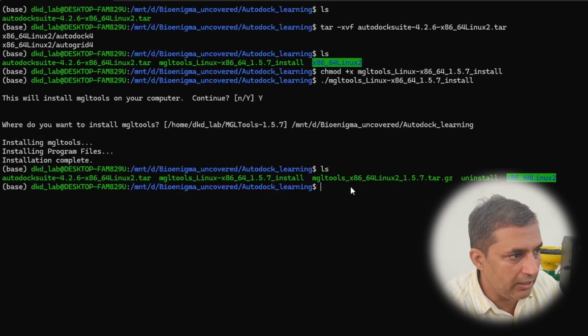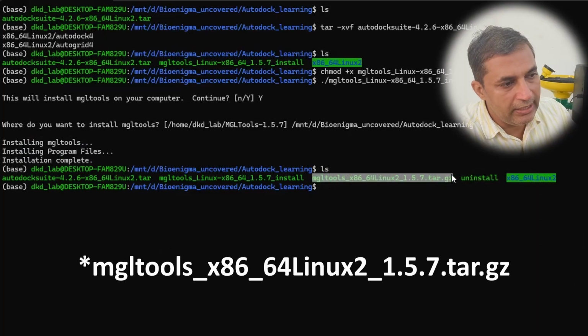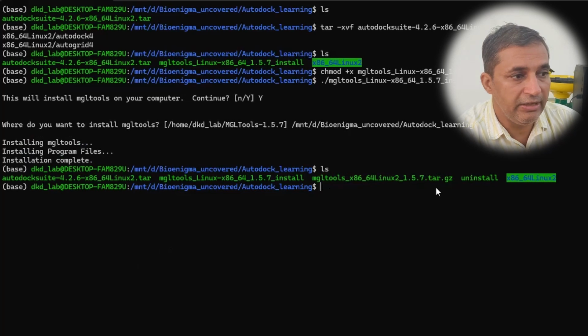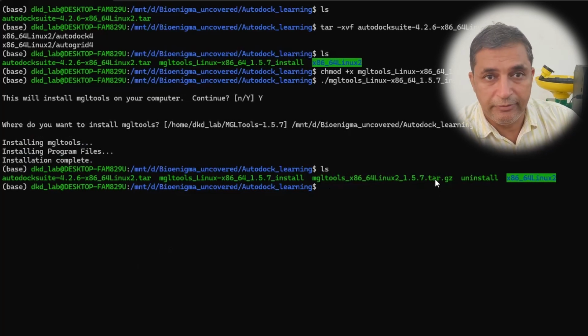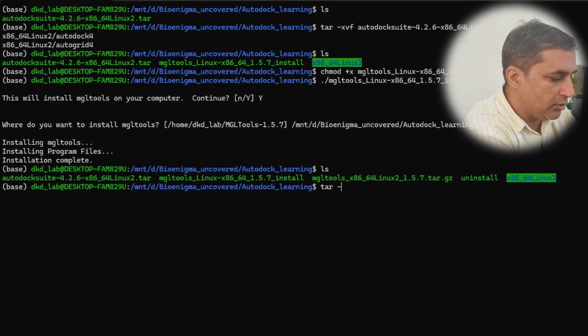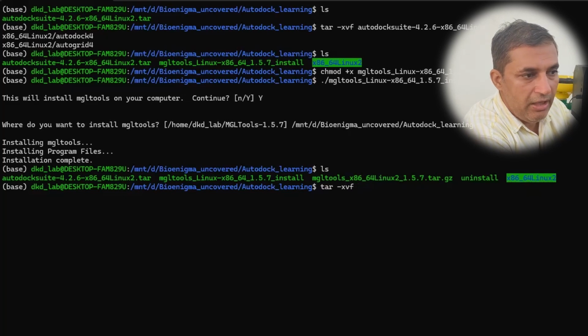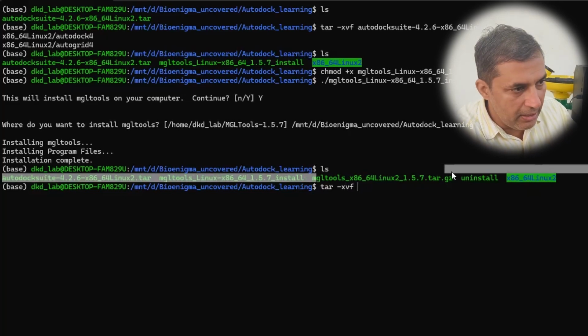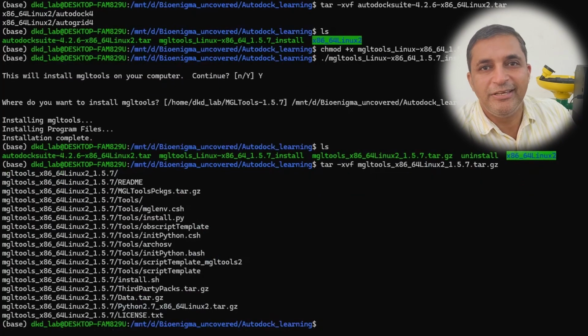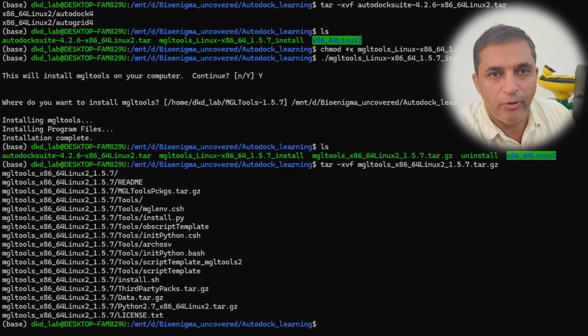Once I hit the enter button, you will see a new file appears on my screen, that is mgl tools underscore x underscore 86 underscore 64, and this file has the extension .tar.gz, which means it is a compressed file. I need to uncompress the components of this file. So I'm going to type tar space dash xvf followed by this file name. I will just copy paste it here, then I will hit the enter button, and you can see within a few seconds all the components of my MGL tools are now installed.